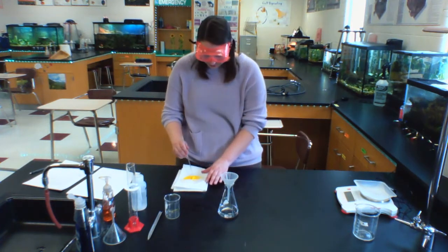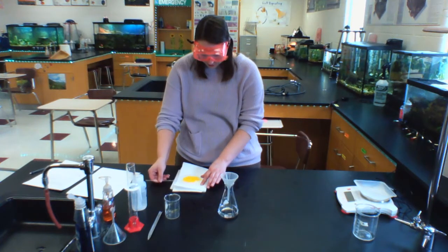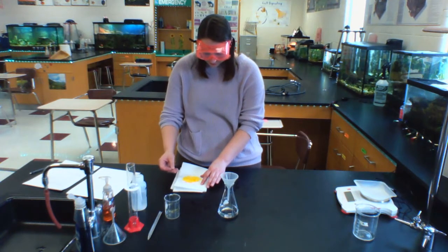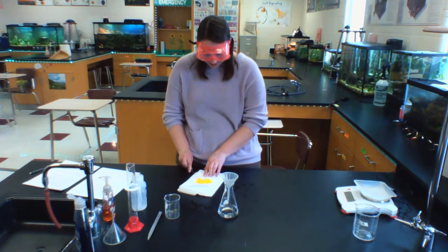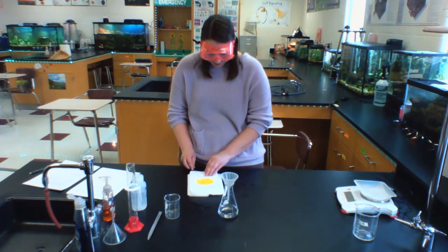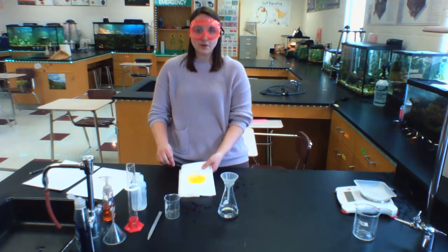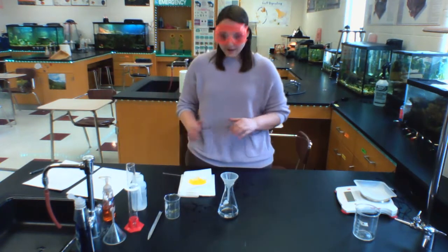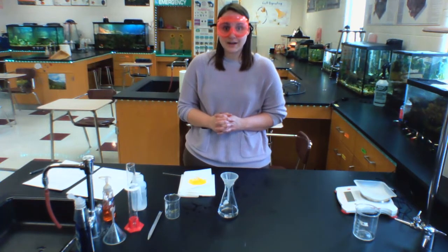And I'm actually going to use my stirring rod to kind of spread it out so that it can have a better opportunity to dry here as well. And hopefully this will be dried tomorrow and I will be able to find the mass of what I have on my filter paper when I return to make you a new video. So this will sit here on the paper towel. It will dry, and hopefully tomorrow I will come back, find a dry product, and be able to find the mass of that dry product and share that with you.